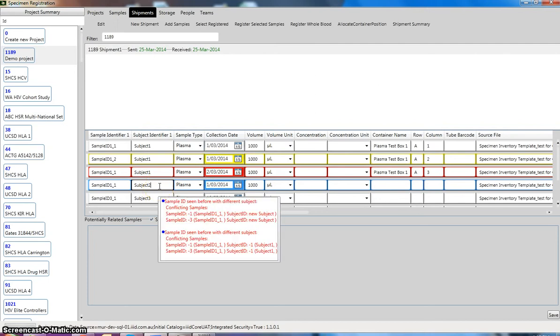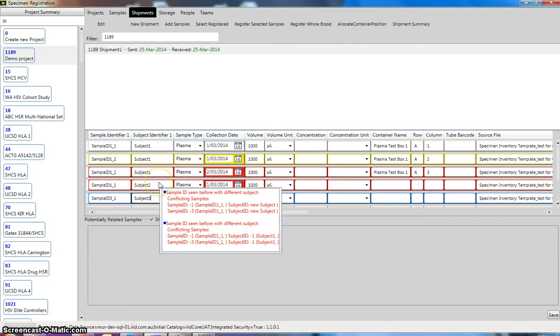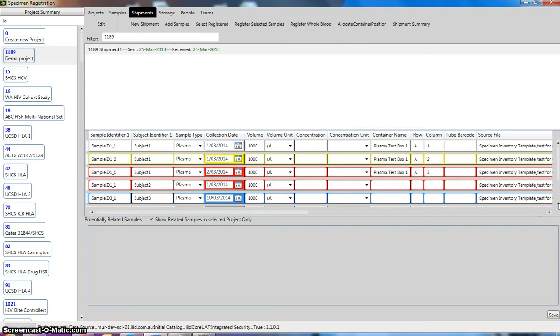So what I usually do is write back to collaborators and confirm the sample and what the correct information is. So at the moment I will just leave those as red until I hear back from the collaborators. Once everything seems okay, we can register the samples. To register the samples, you just select them like this, and then we go to register selected samples.